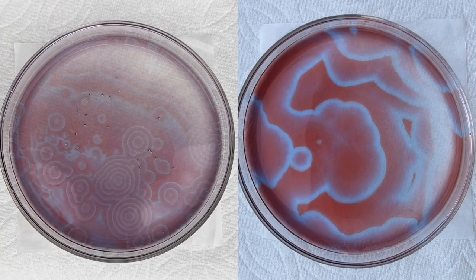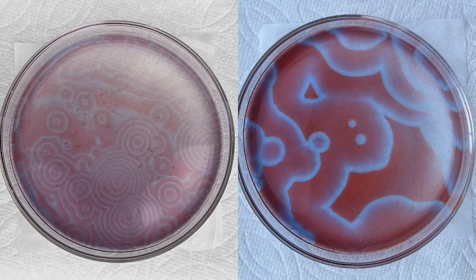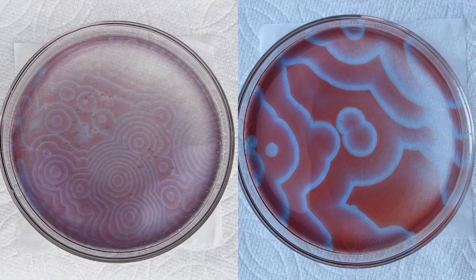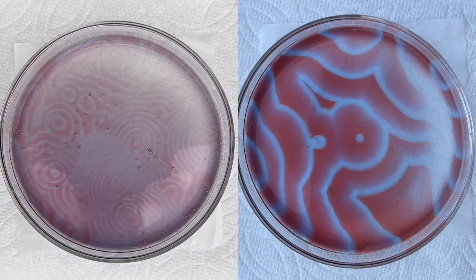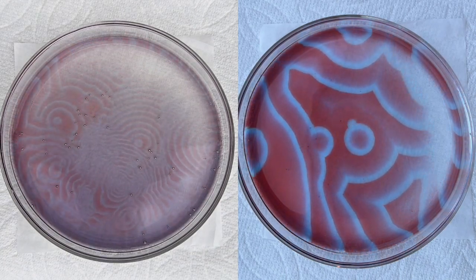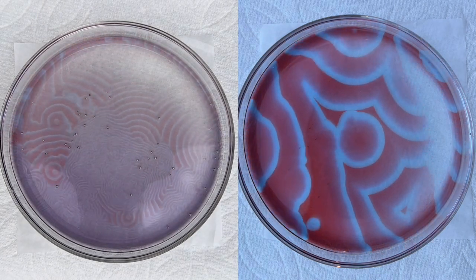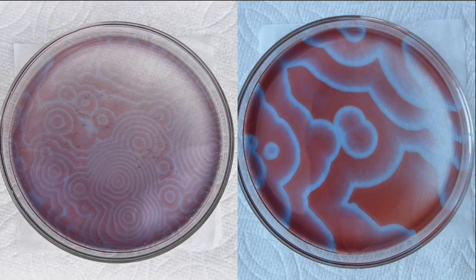One thing I've noticed is that the Ferroin-only version, despite creating a different pattern each time, will always work as long as I mix all the ingredients with the same ratio in the correct order. Considering that the ingredient ratio will be slightly different for each run, the recipe without cerium, which is the Ferroin-only version, has a relatively large tolerance for variations in the starting conditions.